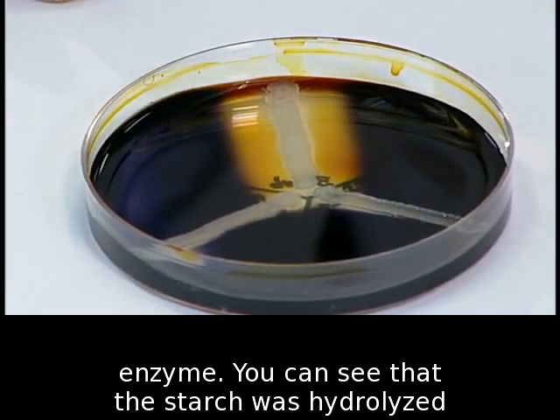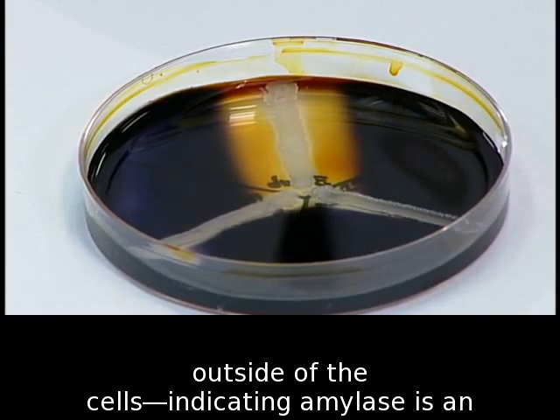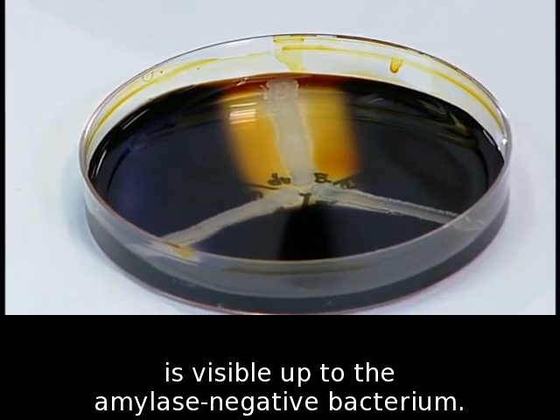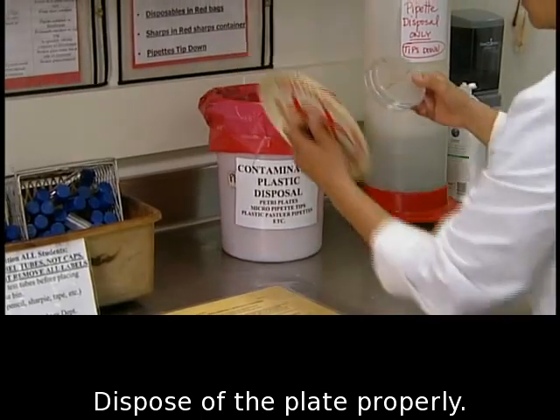You can see that the starch was hydrolyzed outside of the cells, indicating amylase is an exoenzyme. This bacterium hydrolyzes starch. Starch is visible up to the amylase negative bacterium. Dispose of the plate properly.